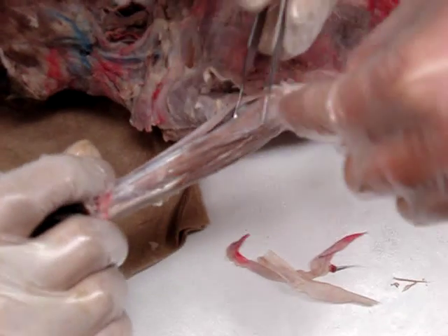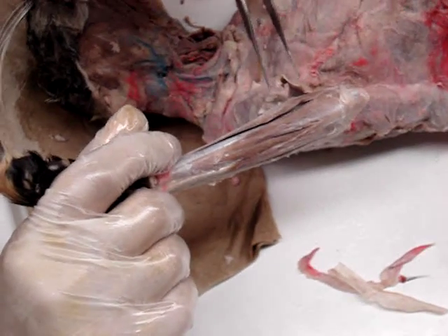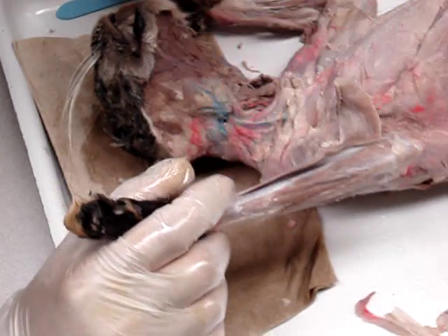Is that the underneath one? No, the whole compound. You guys don't need to know the one under it. The one right under it is — you guys don't need to know it. So the whole thing is, this is the actual flexor carpi ulnaris. This one is the flexor digitorum profundus, but you guys don't need it.